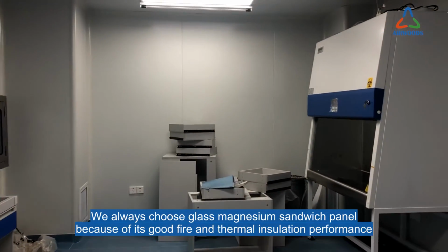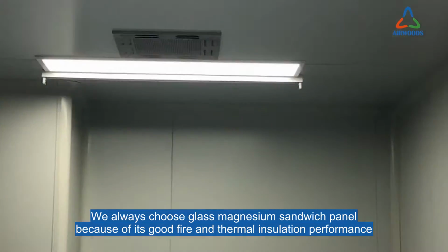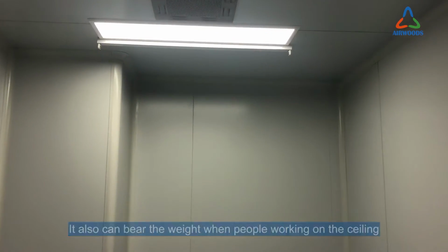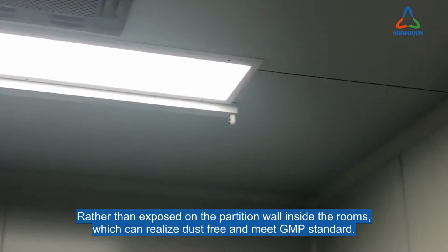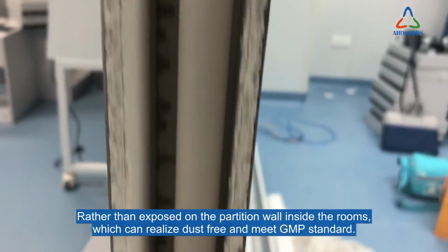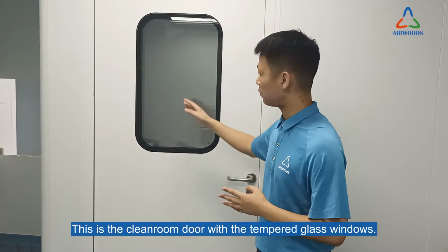We always choose glass magnesium sandwich panel for its good fire and thermal insulation performance. It can also bear the weight when people work on the ceiling, and wire pipes and water pipes can be introduced through the channels inside the panels rather than exposed on the partition walls inside the rooms, which realizes dust-free conditions and meets the GMP standard.